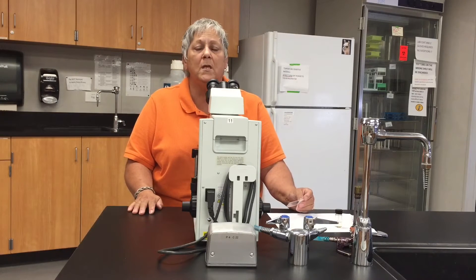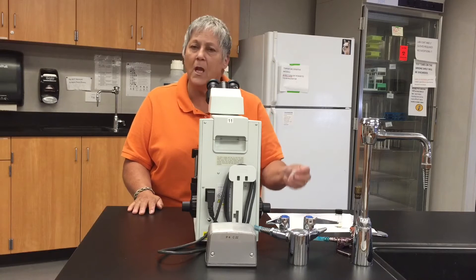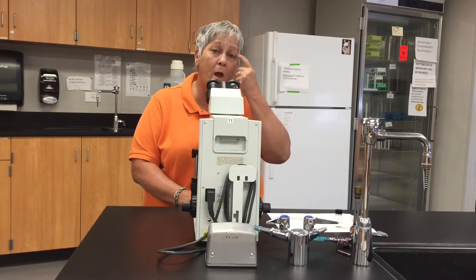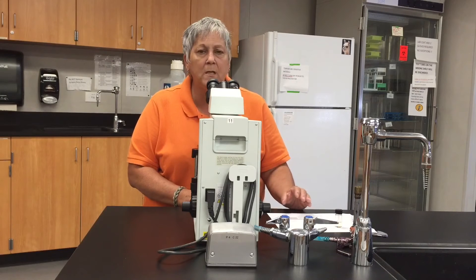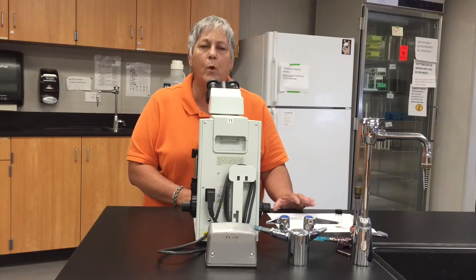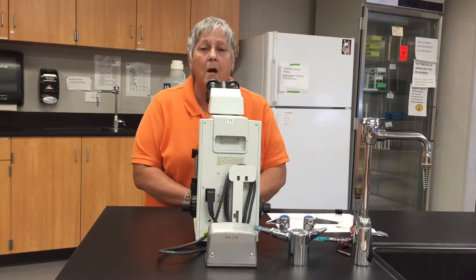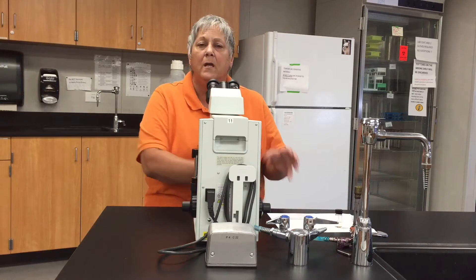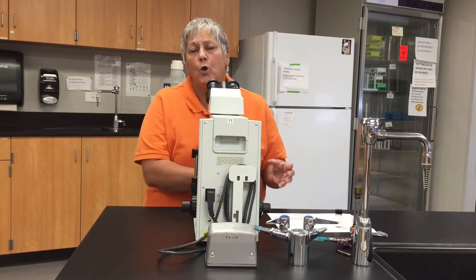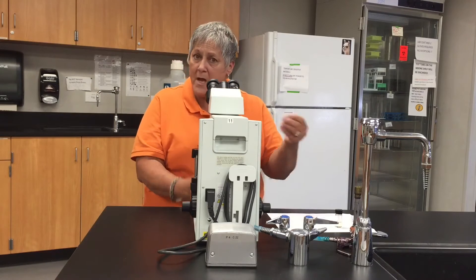That of course is the objective lens — it has the yellow ring on it. I take my slide and I place it down on a piece of white paper, looking to see if I can detect where the specimen is located. I can actually make out the three smears, which gives me an idea where to look when I put this slide on the microscope.